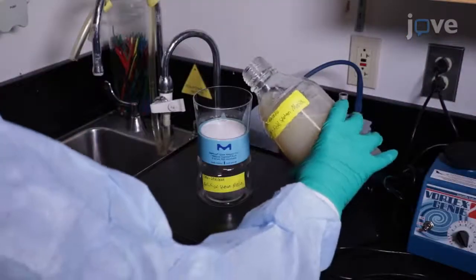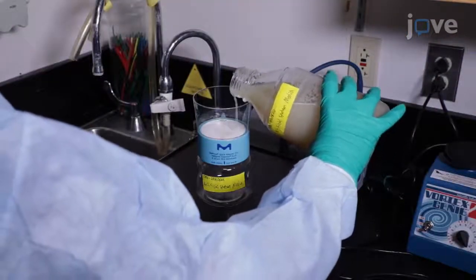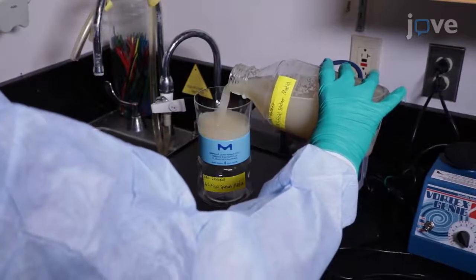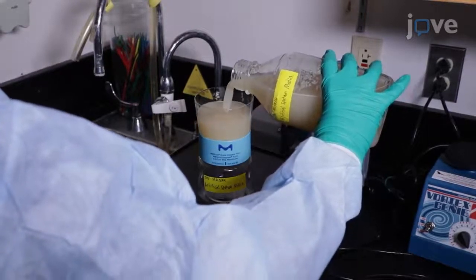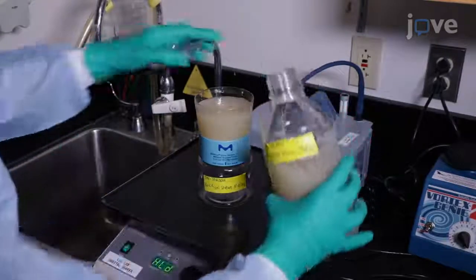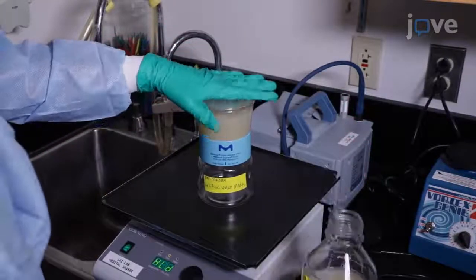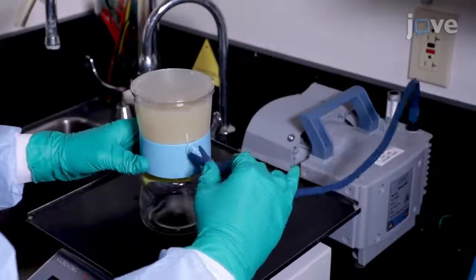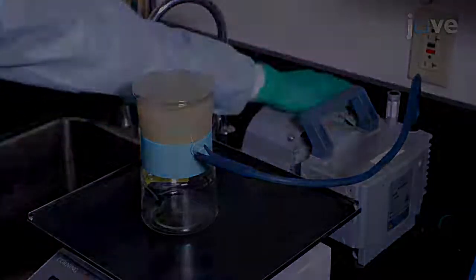Then, to start the filtration process, transfer 200 milliliters of unfiltered artificial sputum medium to a vacuum filtration system with a 0.22 micrometers pore size filter. After connecting the filtration system to the vacuum pump, turn on the vacuum pump.